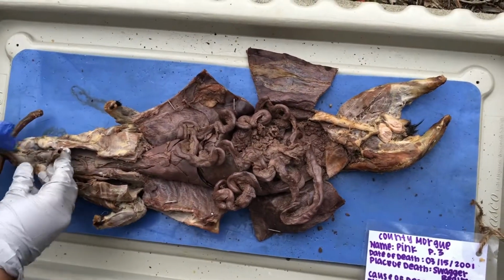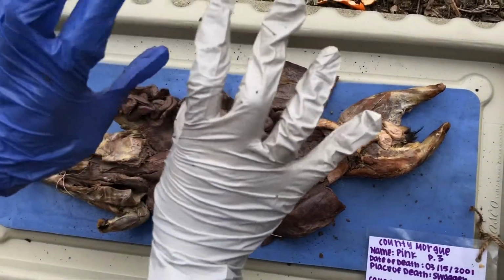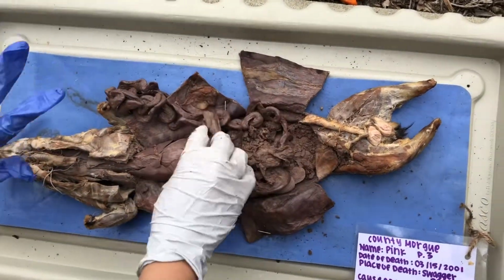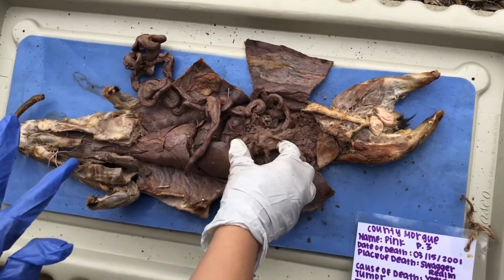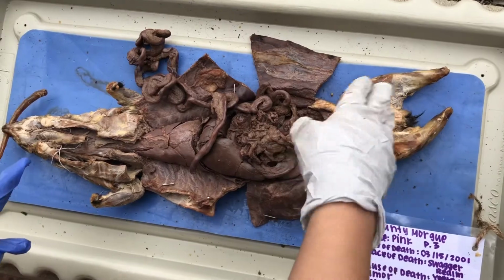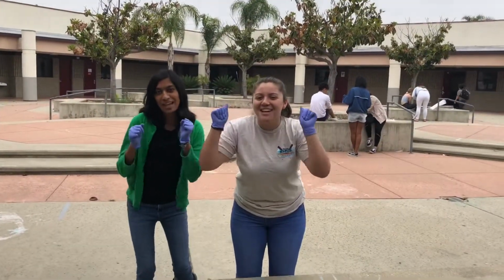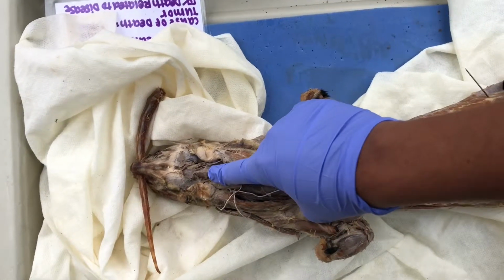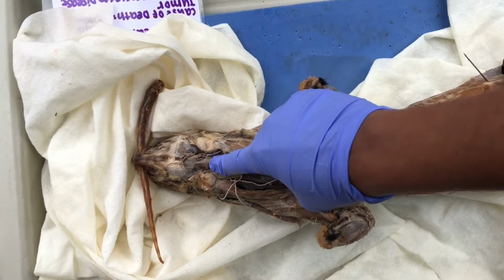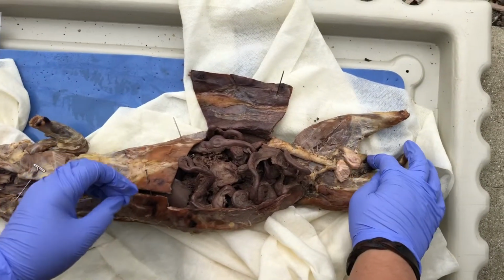For example, the esophagus and the large intestine muscles will constrict and then relax to move the bolus down through the digestive tract until it's time for elimination. Push it real good. The trachea is the windpipe. It provides air into the lungs. Waste is the unnecessary material removed from the body.